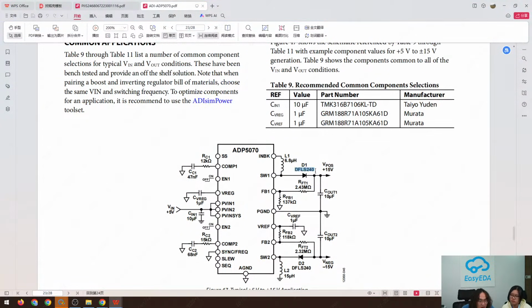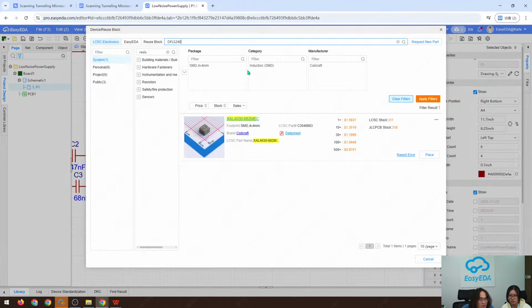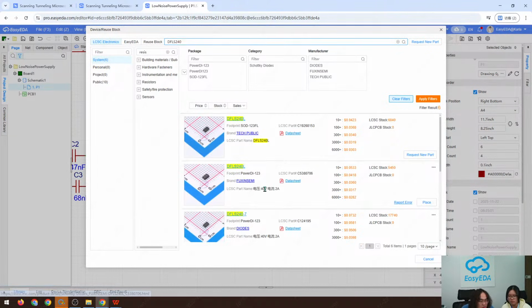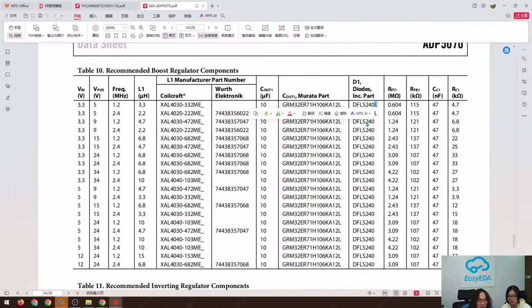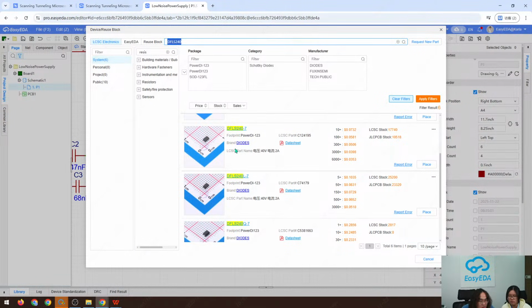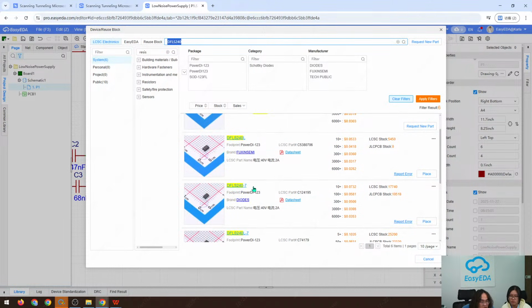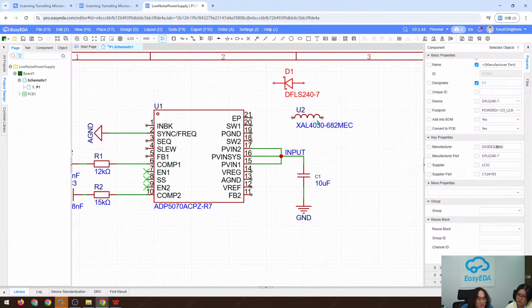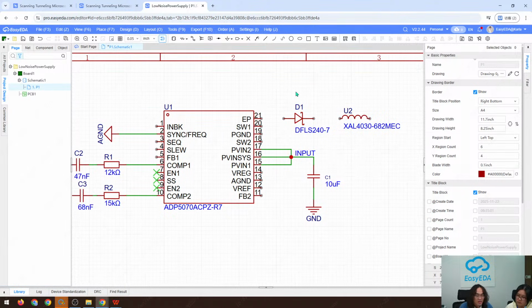And we need a DFLS240. Again, we just search. Oh, no L, no L. Dash 7. There might be a little bit of difference with different suffixes. So again, just for demonstration, we just choose this one, and if you have any requirement, you have to take a detailed look at this component. I just place it here for demonstration.